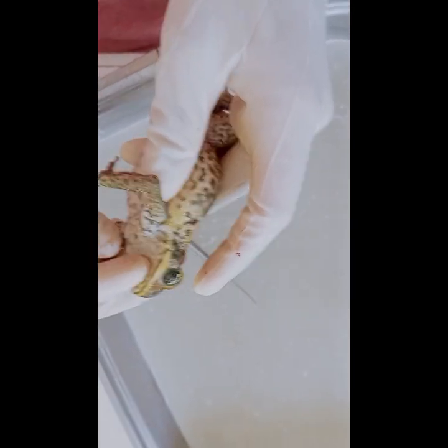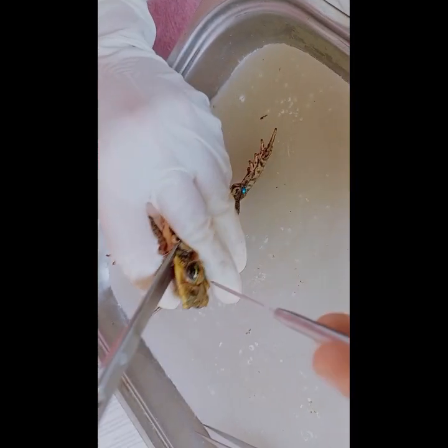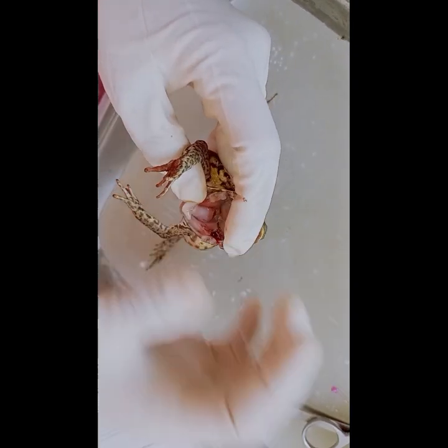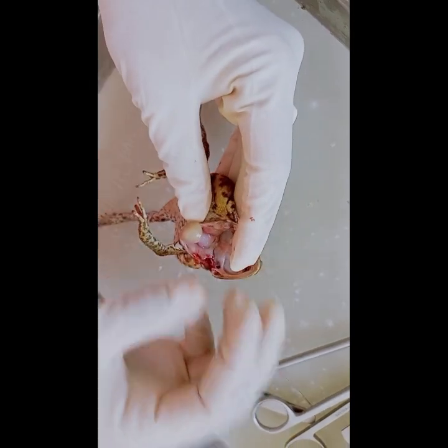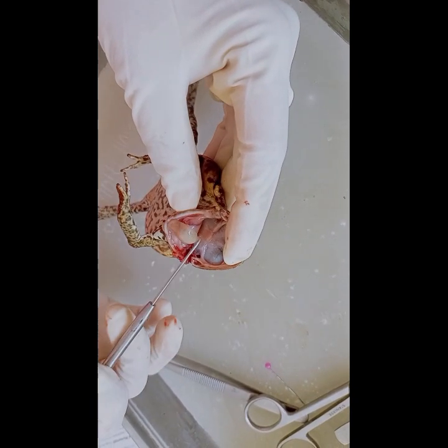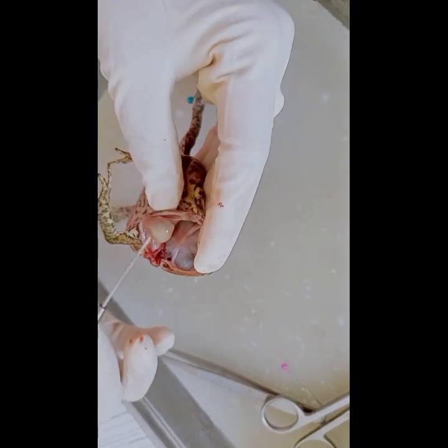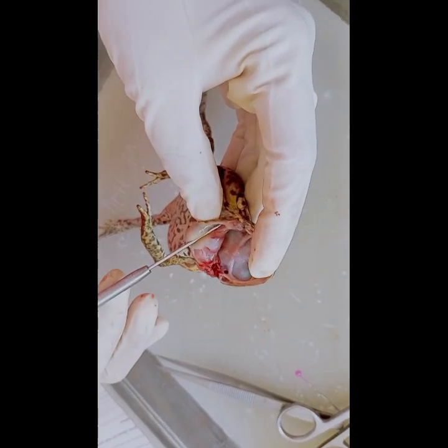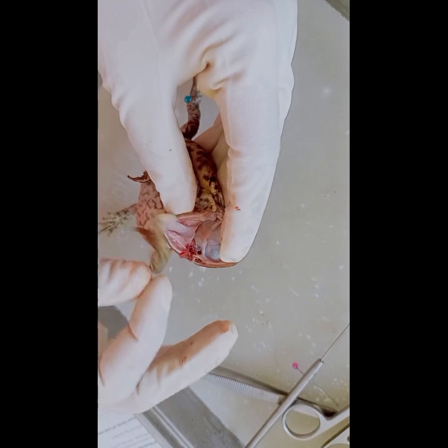After we feel the frog's skin, we'll cut the corners of the mouth so that the mouth will open more easily. We'll locate its tongue. We observe that the tongue of a frog is long, sticky, and can be rapidly extended to catch prey. It is attached at the front of the mouth and is used to capture insects and other small organisms. Now we feel that the tongue of a frog is so sticky, so we can observe that it easily catches its prey as food.